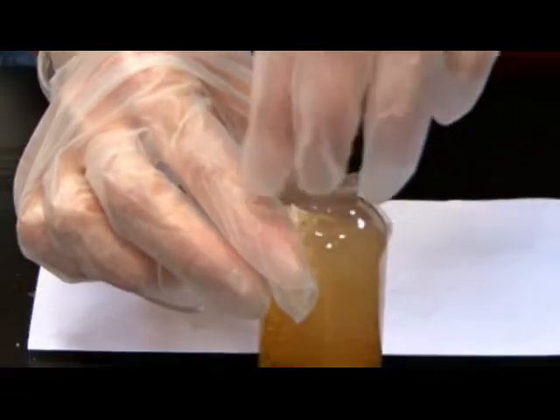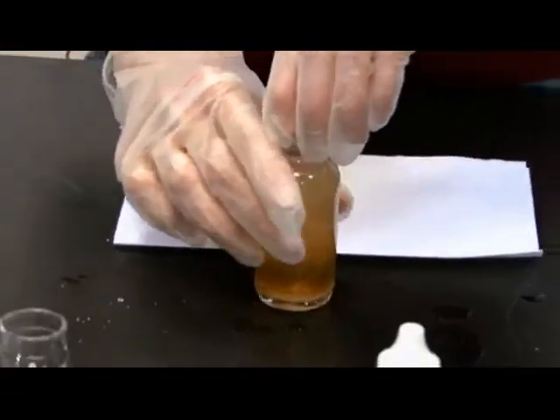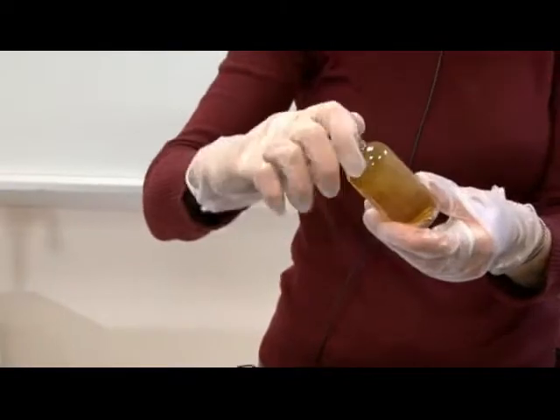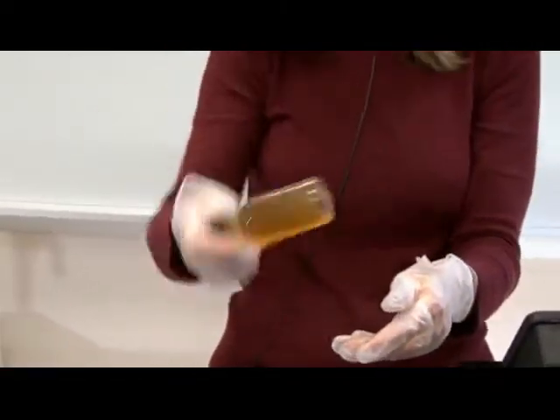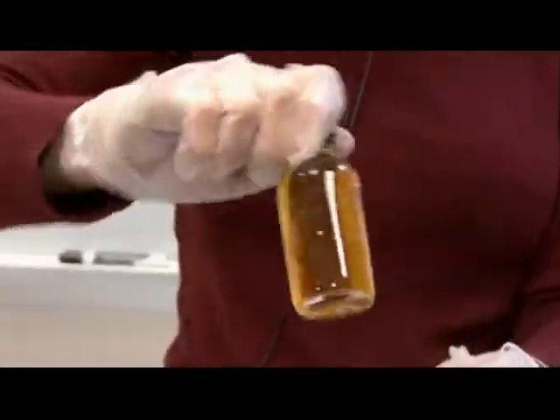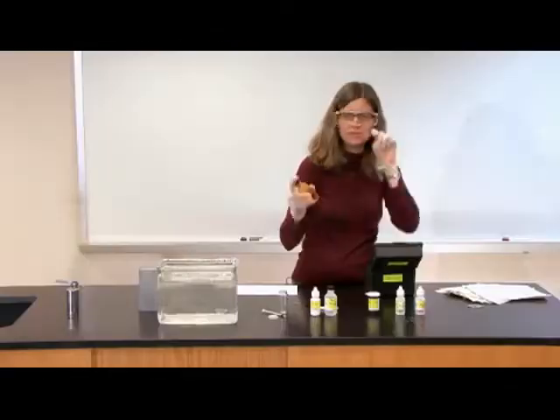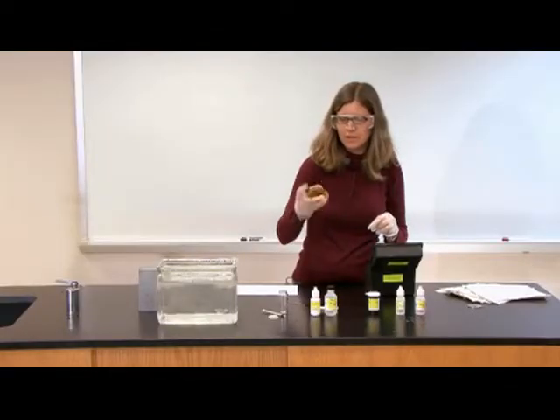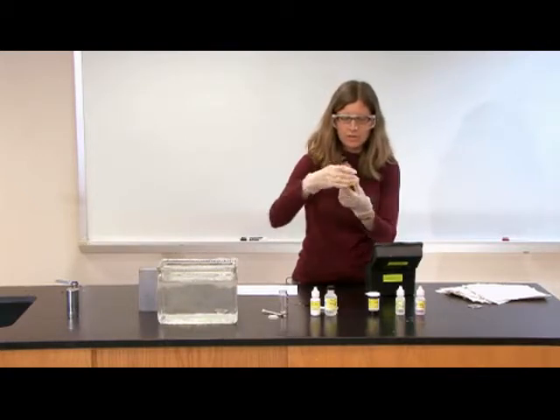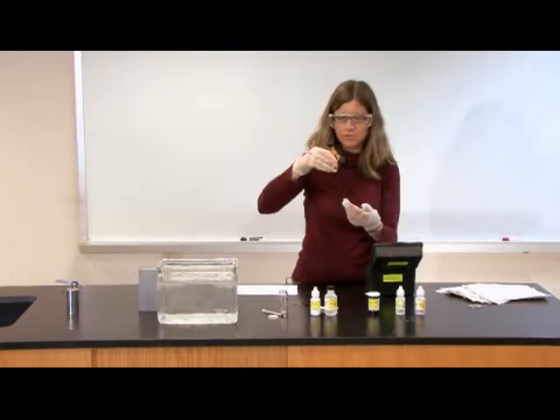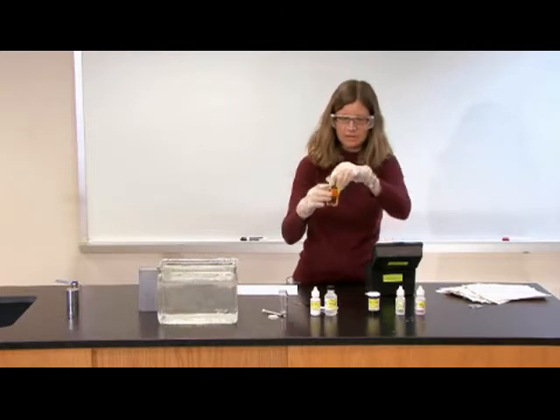Then I'm going to cap and mix, and I want to get the precipitate to dissolve. There might be some kinds of little particles in the water that just aren't going to dissolve, like bits of decomposing leaf, but I want to make sure that the powder, that the granules, are completely dissolved, the sulfamic acid powder.